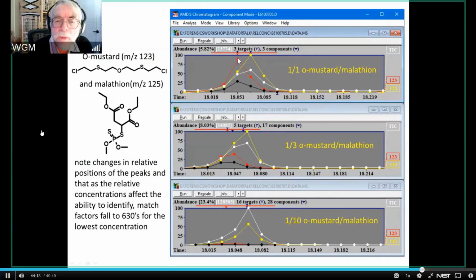And you can see when they're 1-to-1, they're about a scan apart. This is fairly fast. These scans are fairly close. I mean, this is, in some respects, fast chromatography, because you're not getting very many peaks. You're not getting very many scans across a peak. And as the concentration reduces, you get to the point where you really can't tell that this is O-mustard. That is to say, the match factor drops low enough that your identification is not confident. However, AMDIS is still telling you that there are two components there.